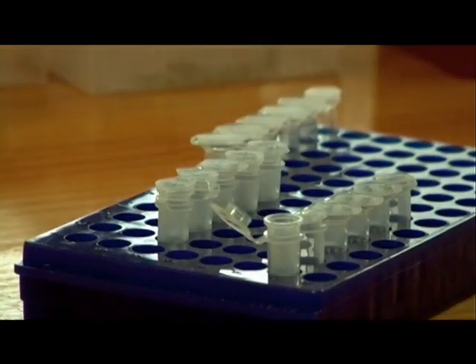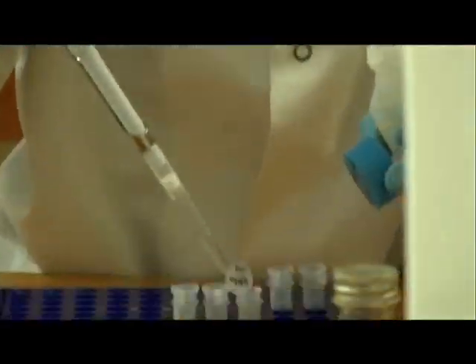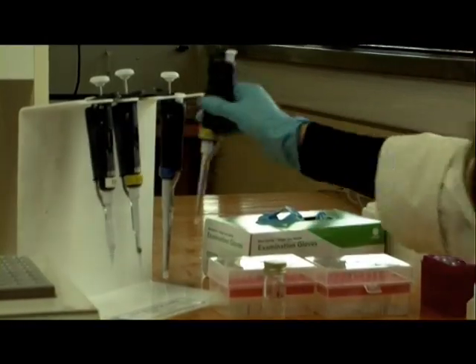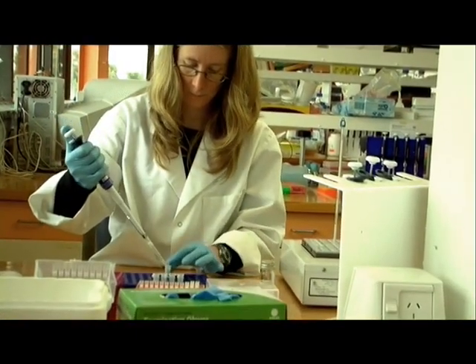Next, the DNA is washed with a buffer containing ethanol and salt. The ethanol washes out the contaminants, while the salt ensures that the DNA is still bound to the matrix. To recover the DNA from the purification column, an elution buffer is added. This buffer provides the chemical conditions which allows the DNA to unbind from the silica matrix. Now when the column is centrifuged, the DNA will be released, or eluted, into a clean tube.